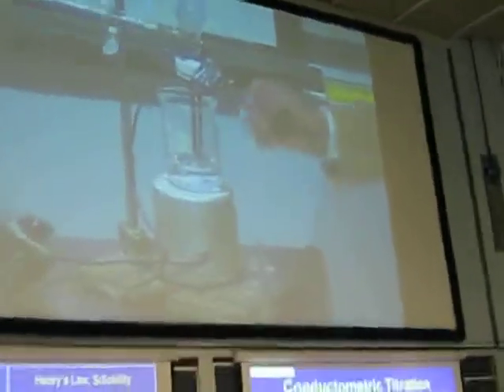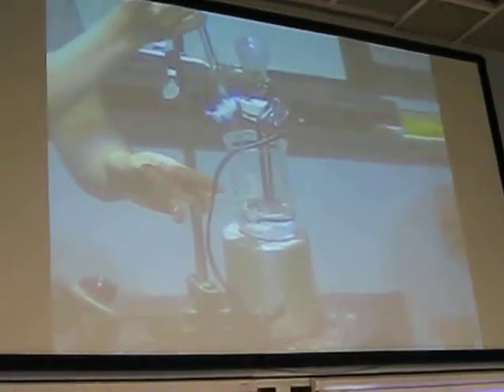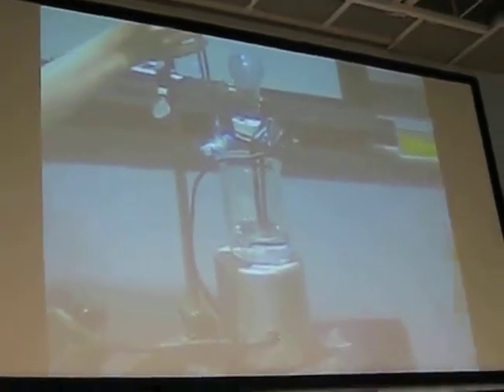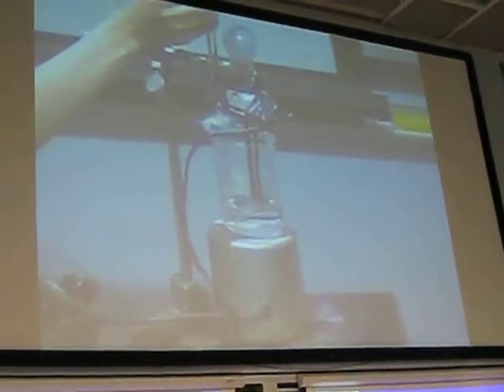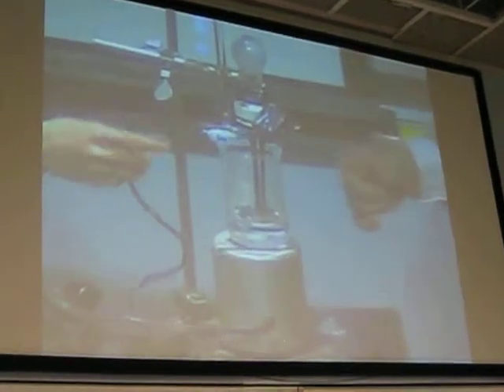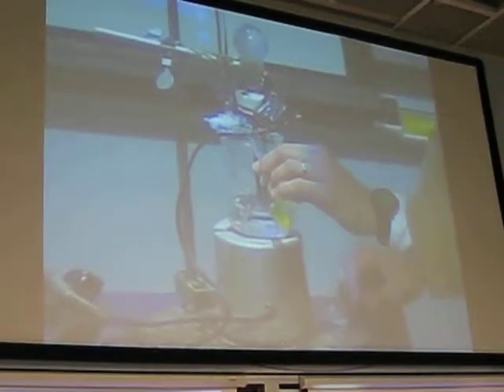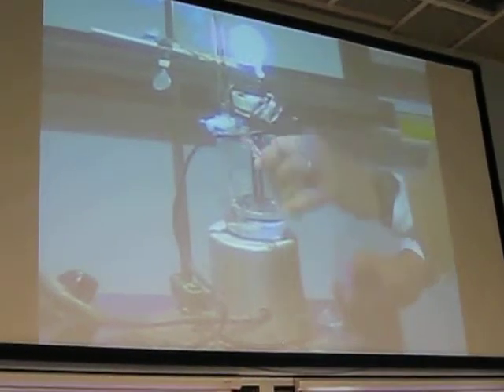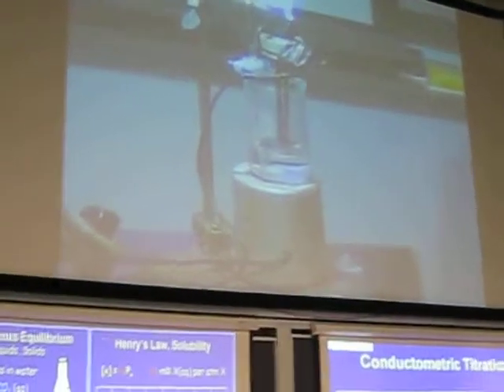A lot of people think pure water conducts electricity, but it doesn't really conduct electricity very well. You need ions in the water. I can make ions in the water by adding barium hydroxide, because barium hydroxide is very soluble. That'll get me lots of barium ions and lots of hydroxide ions, and those ions will conduct electricity, so let's look what happens when I add ions. Look at that. I get a light. So that tells me there's lots of ions in solution right now.